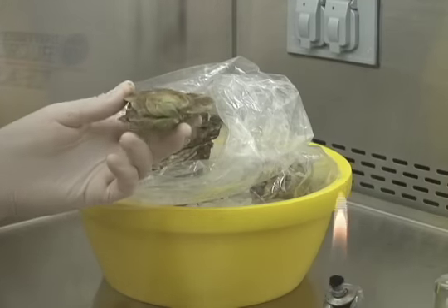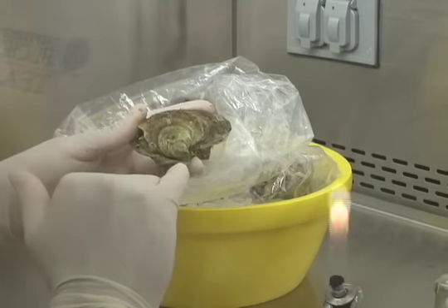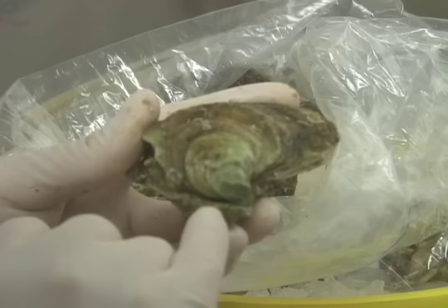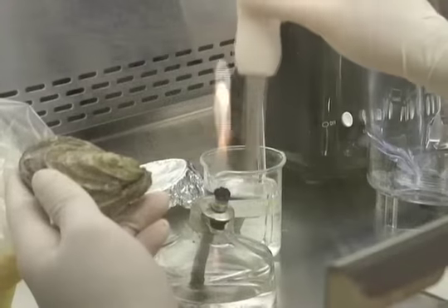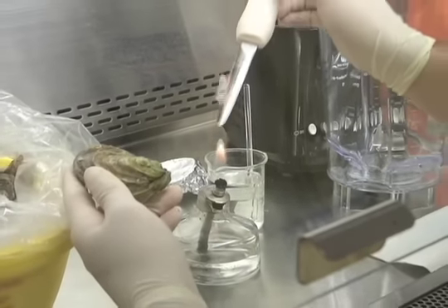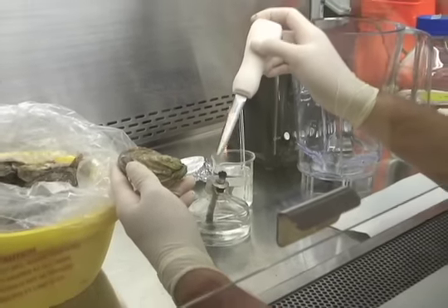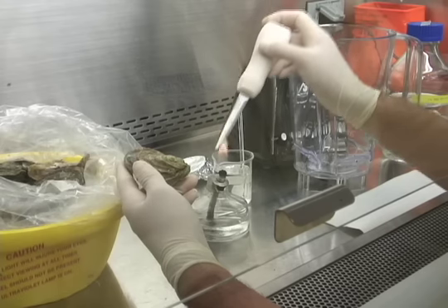Take our individual oyster here. This notch where the shell comes together is the hinge and that's where we're going to shuck it from. Our shucking knife. Dip it in ethanol. Run it through the fire to make sure it's nice and sterile so we don't introduce any foreign bacteria in there.